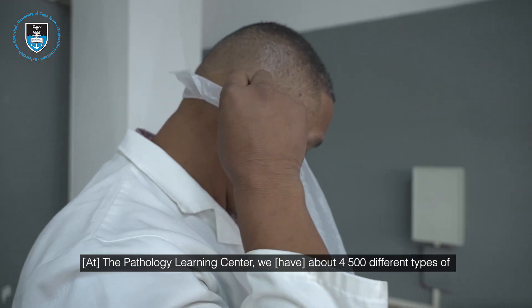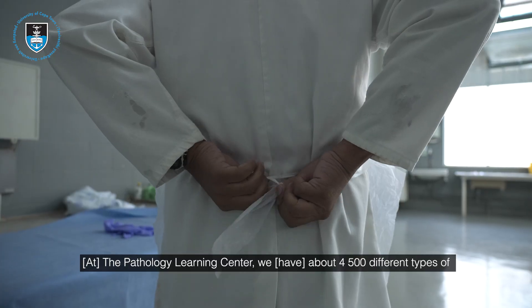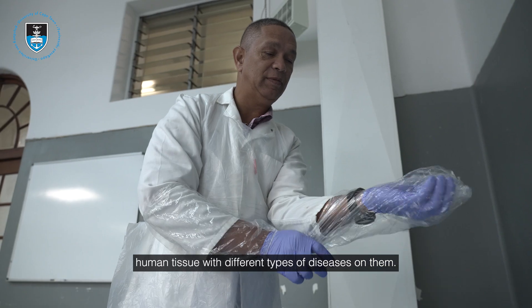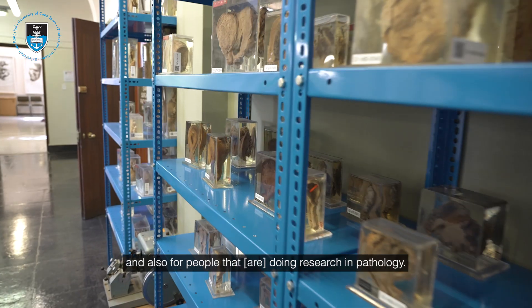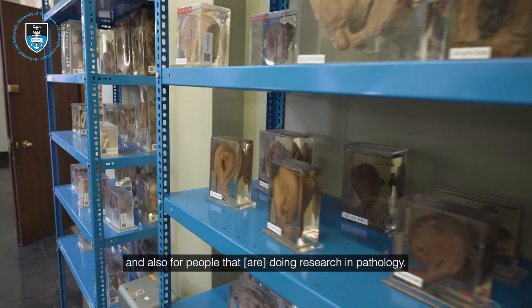The Pathology Learning Centre has about four and a half thousand different types of human tissue with different types of diseases. The reason we are doing the preservation is for future doctors and future researchers, and also for people doing research in pathology.